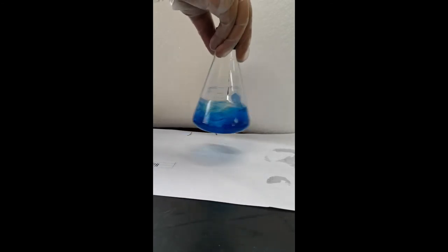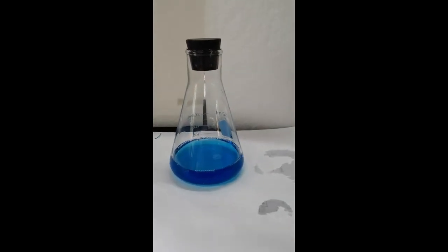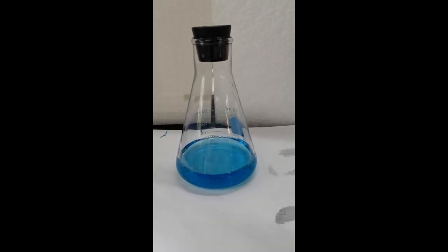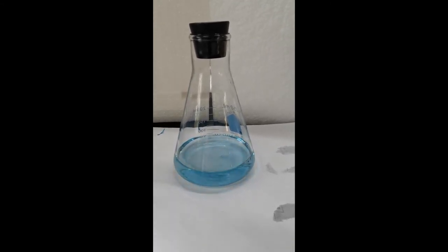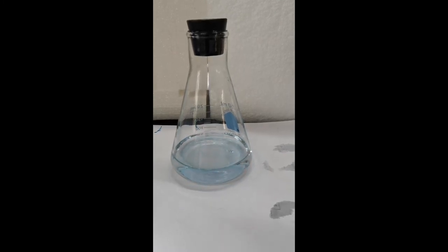Allow to stand for a few seconds. Notice the change in color. Repeat the process several times.